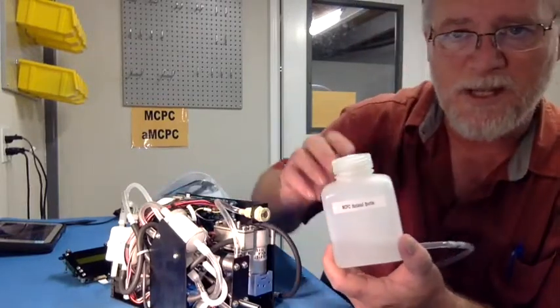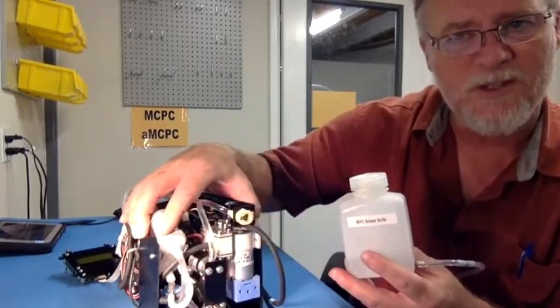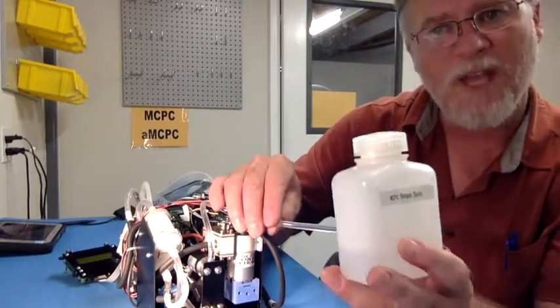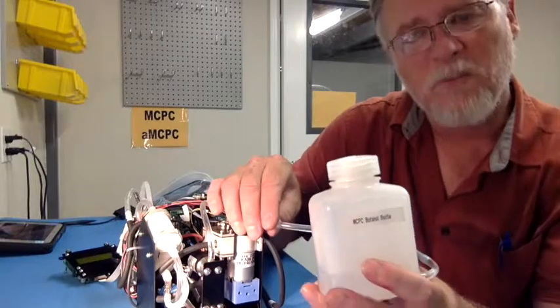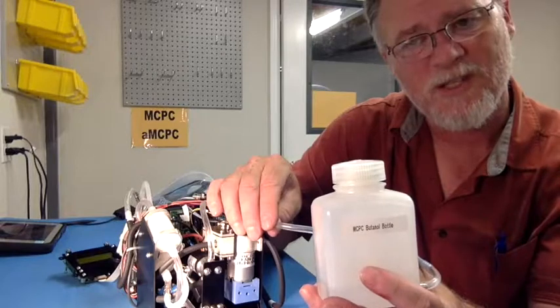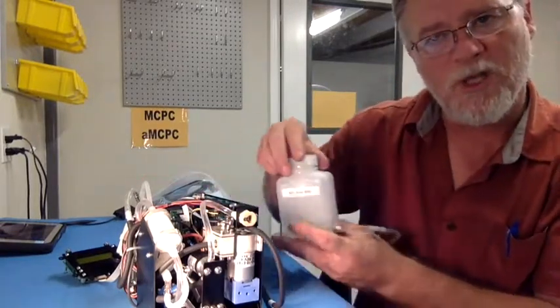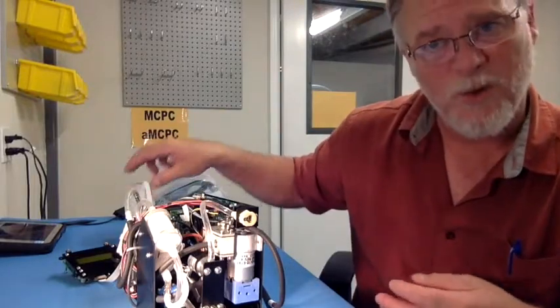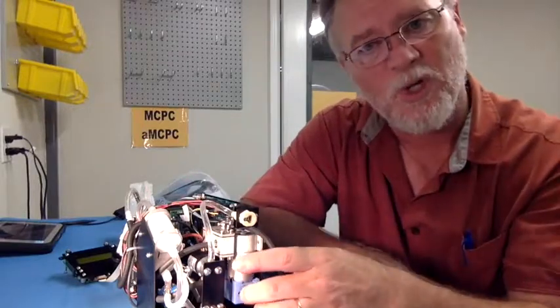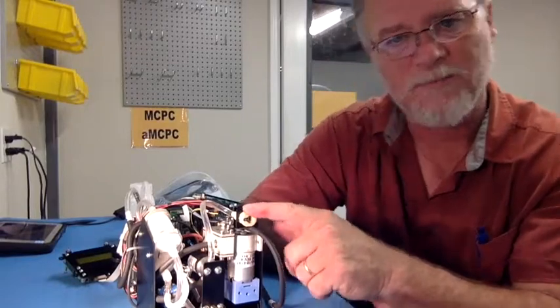It's highly recommended, especially for mobile applications where the unit is shaking a bit because you're mobile, that you fill the butanol at the beginning of your experiment. Make sure that your unit is fully full. That means wait about 20 seconds or so, and then disconnect the bottle and operate the unit without the bottle connected. That will get you roughly 6 hours of runtime before the counting starts to drop because there's not enough butanol liquid in there. So you can actually run a long time without the butanol bottle connected to this fitting.